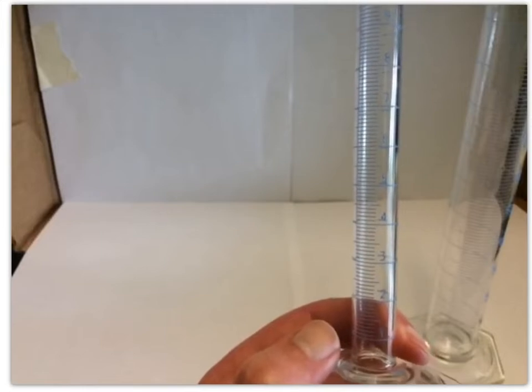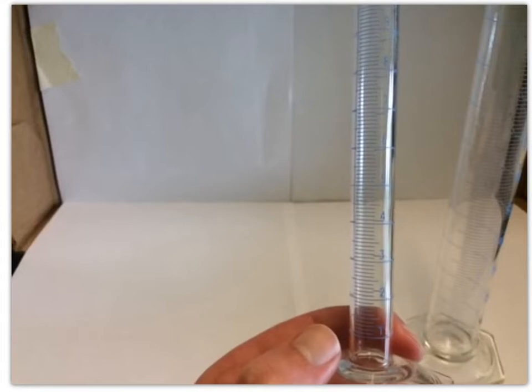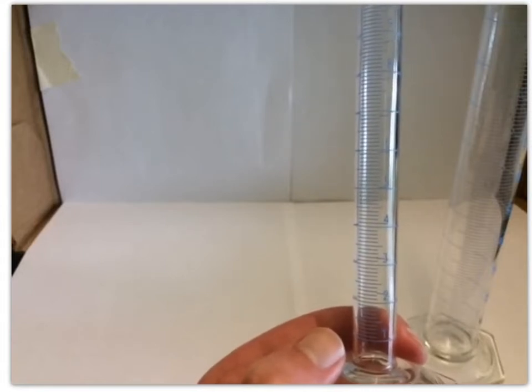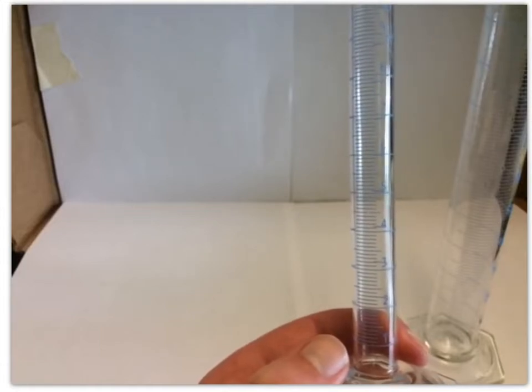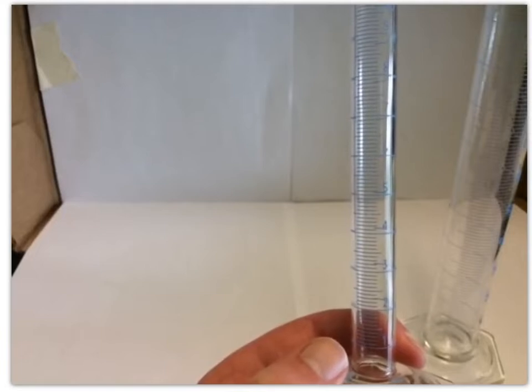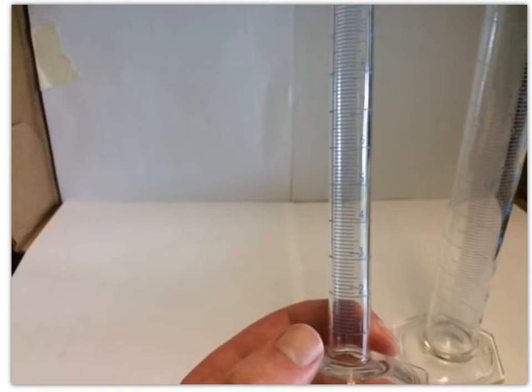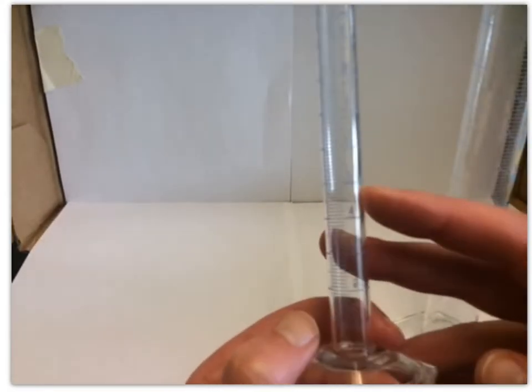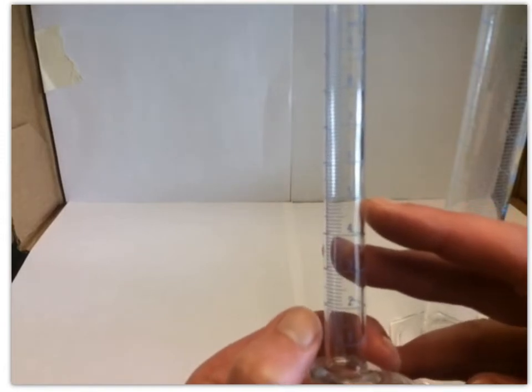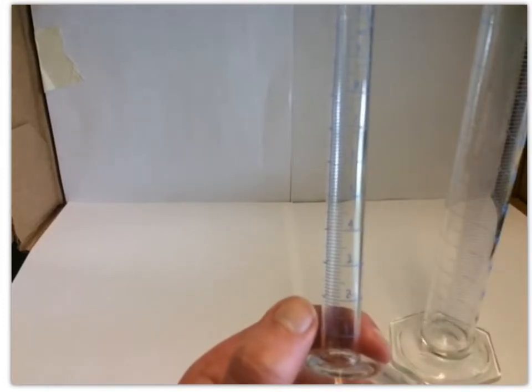When you use any kind of measuring device that is an analog device, something you're reading off of a scale, you should always be estimating one digit past what that scale tells you. So we need to estimate a second decimal place whenever we use this 10 mil graduated cylinder. That second decimal place is going to tell us, does our measurement fall right on a mark? Are we at maybe right at the 5 mils? Or are we somewhere between the 5 mils and the first tick mark?